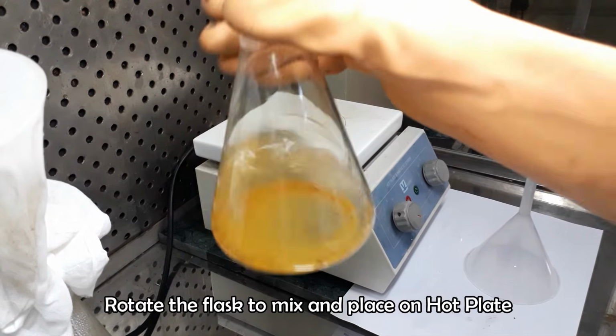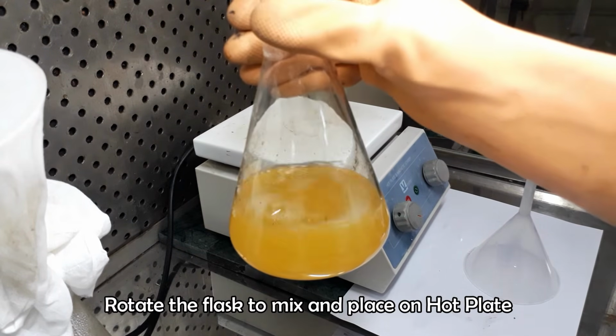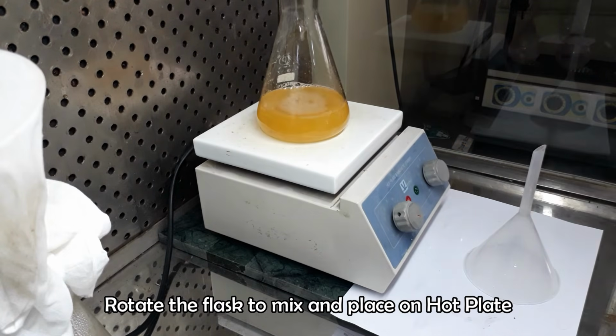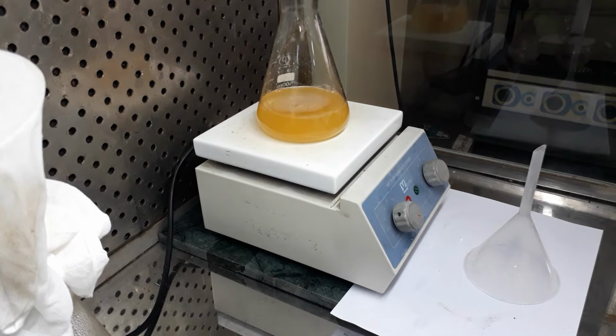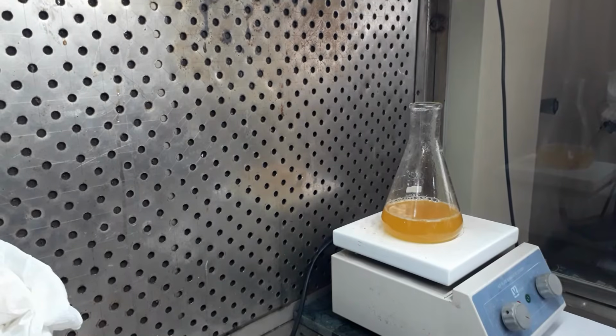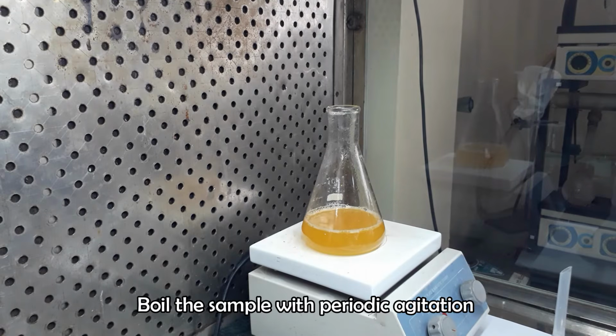Shake the flask to mix the filtrate with sodium hydroxide solution and place it on the hot plate again for boiling. In this step, the sample will be boiled in basic solution. Boil the sample or filtrate for another 30 minutes as it was done previously in acid solution.